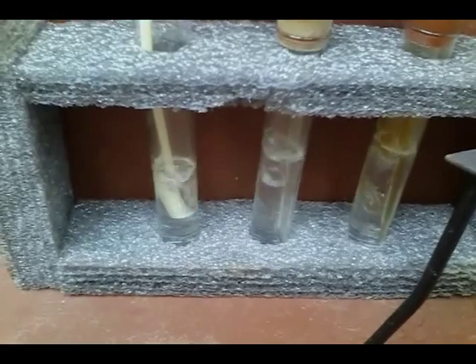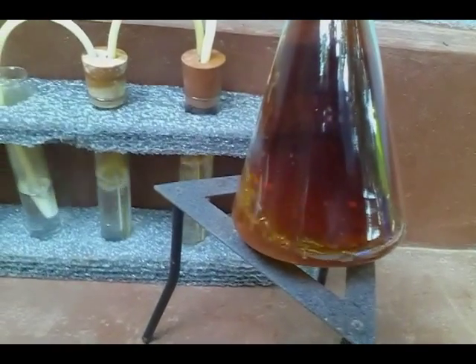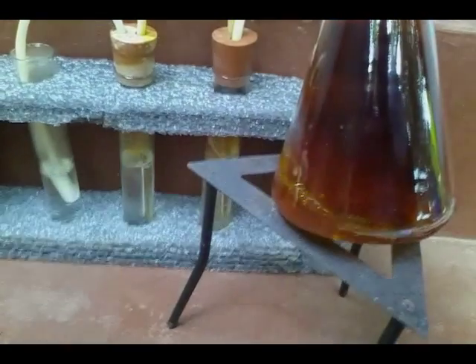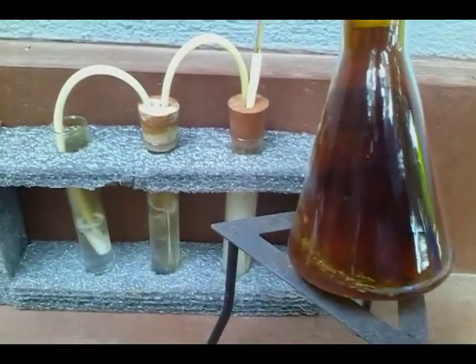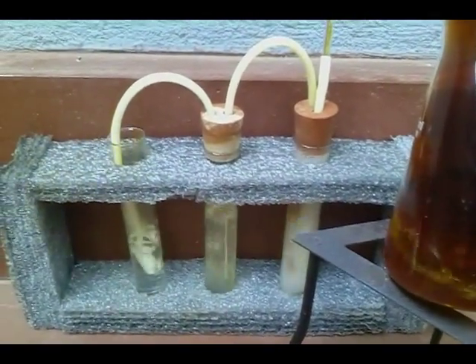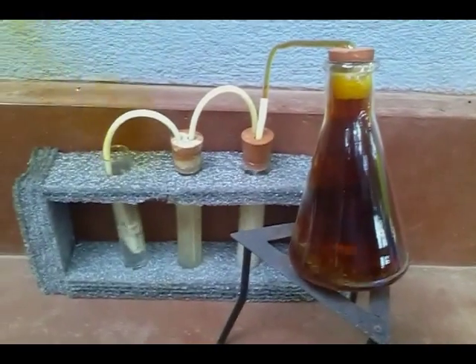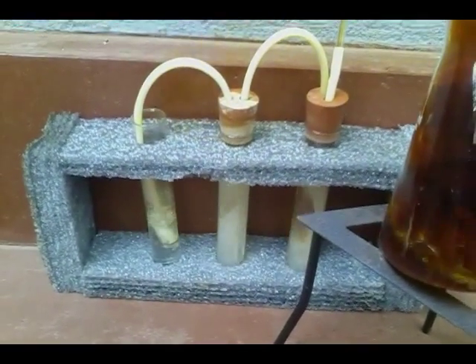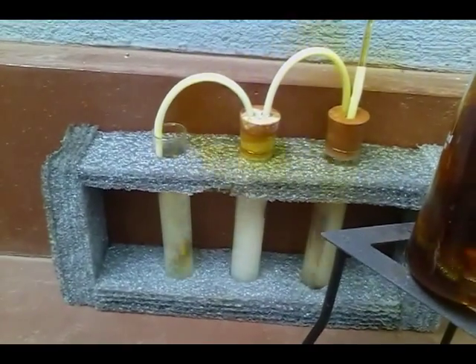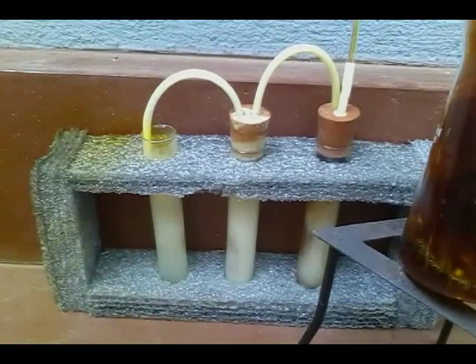In this reaction it produces too much nitrogen dioxide gas, so do the experiment outdoors or in a fume hood. You must remember: once the reaction has started, do not heat the solution because the mixture will explode.